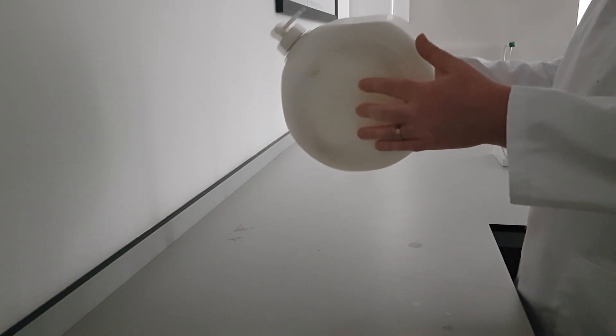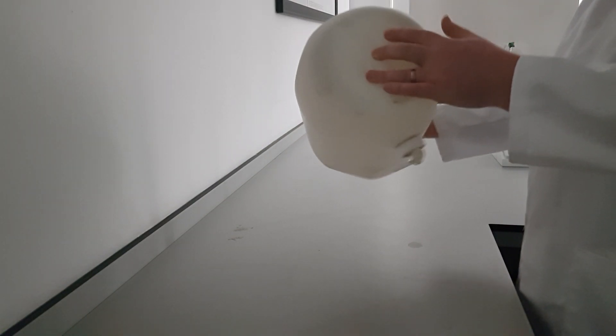This increases the surface area and ensures that most of it evaporates and mixes with the air that's in the container.